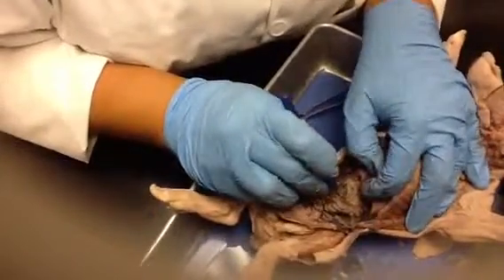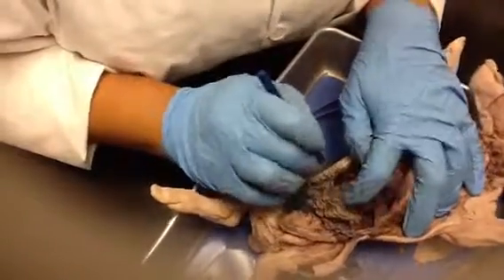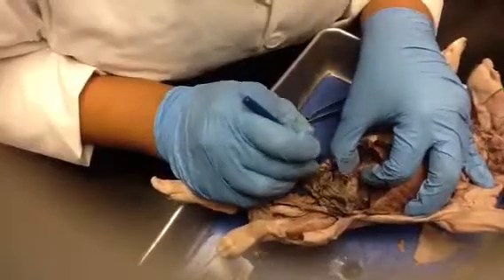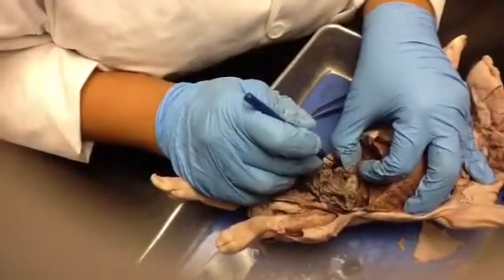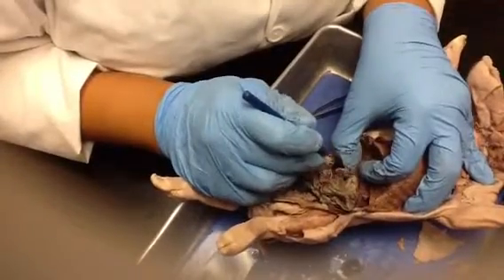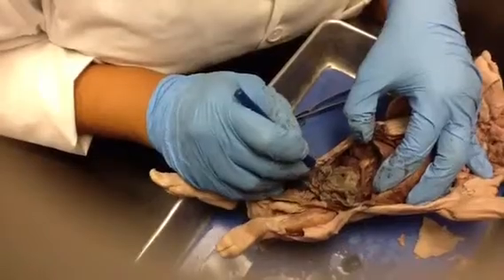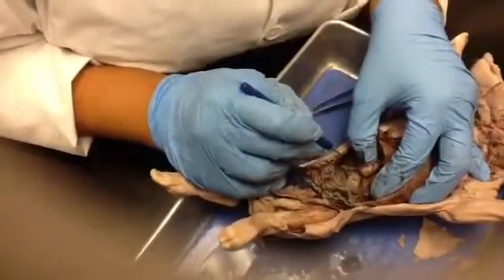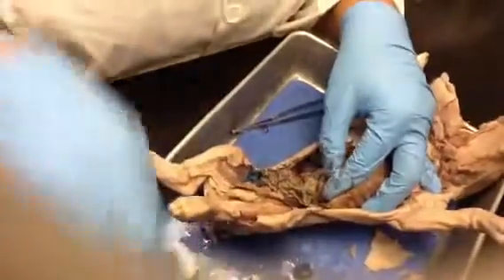Your pancreas goes all the way back here, and that's going to be the tail all the way over there. This is going to be the body, and this part that curves right here is the head. Notice that it's right there close to the duodenum, because that's where it has its little duct, where it releases your pancreatic enzymes into the duodenum. The pyloric sphincter is going to be right at the end of the stomach, right before it. I can cut it open so you can see the pyloric sphincter.